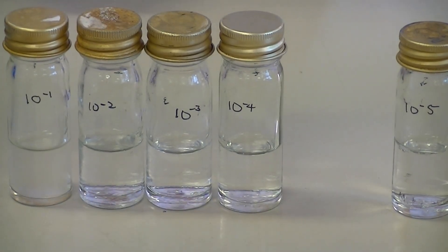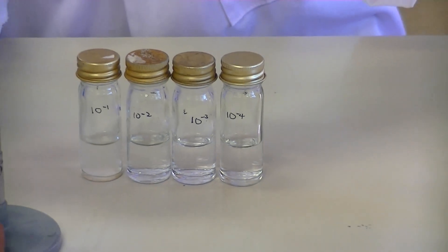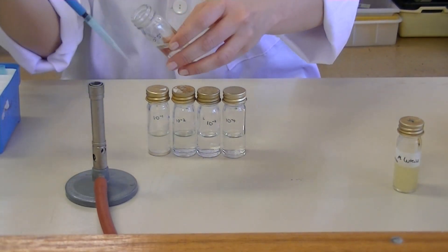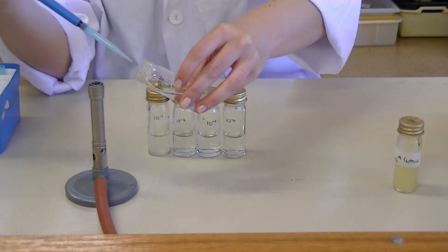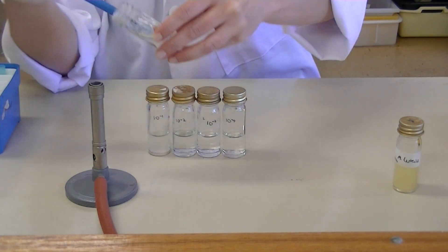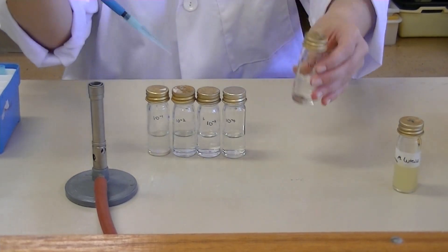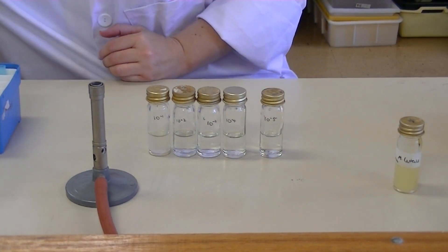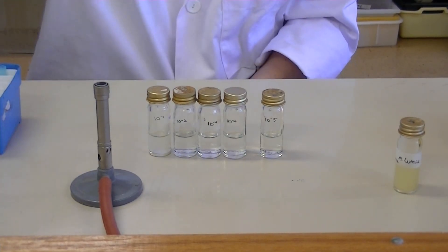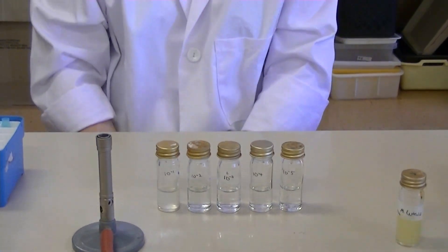It is okay to leave that extra 1 mil in the 10⁻⁵ dilution — it shouldn't affect your spread plate or the number of colonies that grow. But if you are a perfectionist, you can remove that 1 mil: using a clean fresh tip, aseptically remove the lid, flame the neck, collect 1 mil, flame the neck, replace the lid, and eject the tip with the 1 mil into your pipette container. Your serial dilutions are now complete and you can move on to spread plating them.